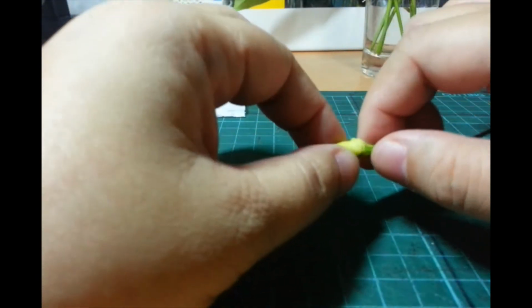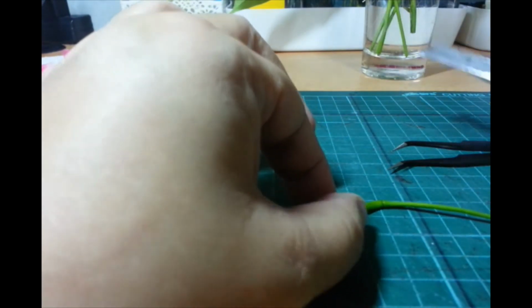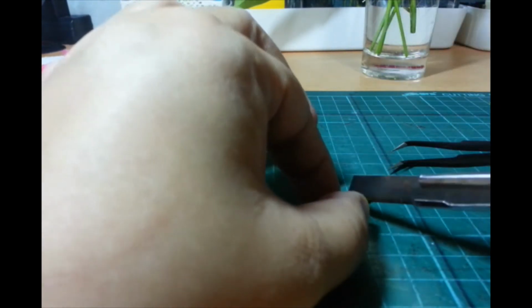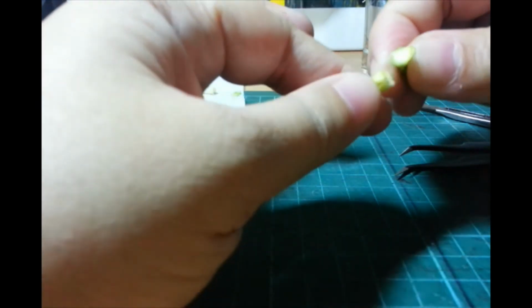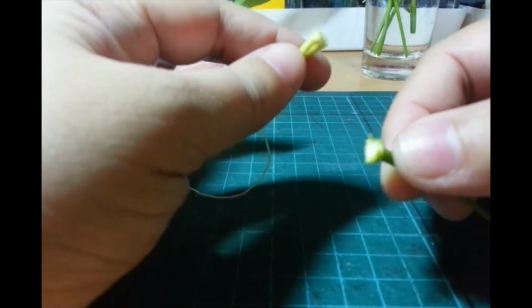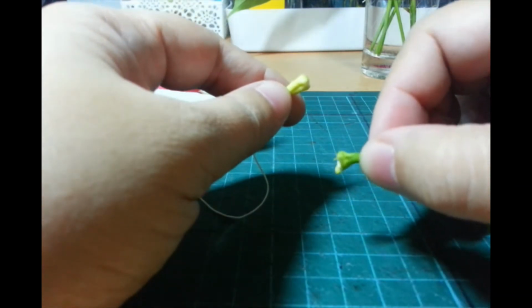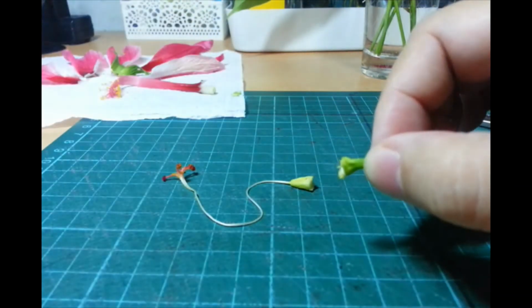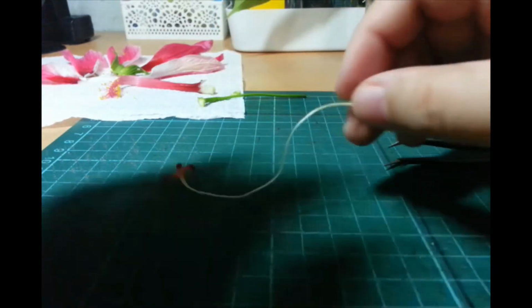Okay? So, I'll just... Oh my gosh, 25 minutes. Ang daldal ko kasi. Okay. Tanggalin ko si ovary. Okay. So, this is the... Well, that was the receptacle. Medyo na-murder ko. Oh, okay. So, in some plants, magiging part siya ng fruit, yung receptacle.